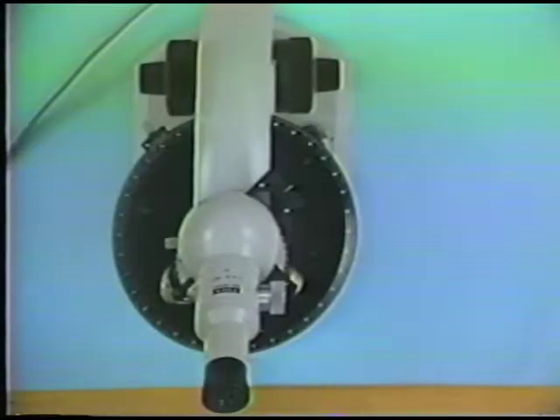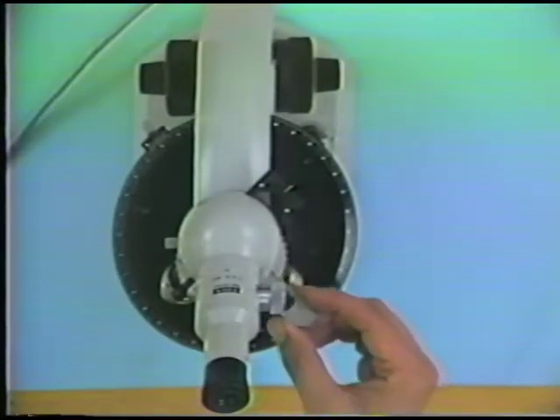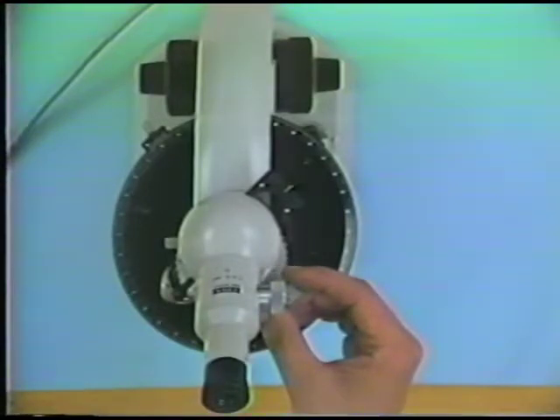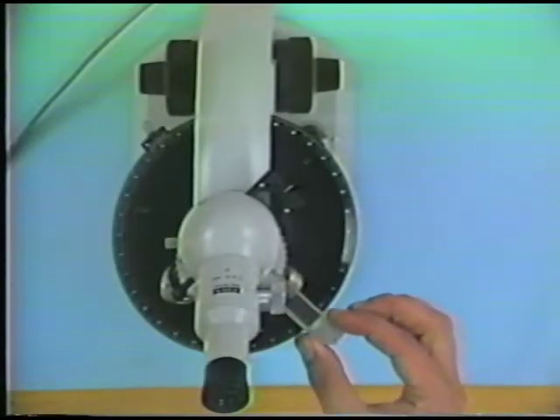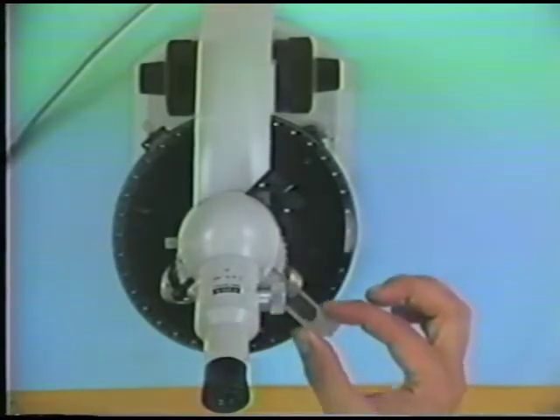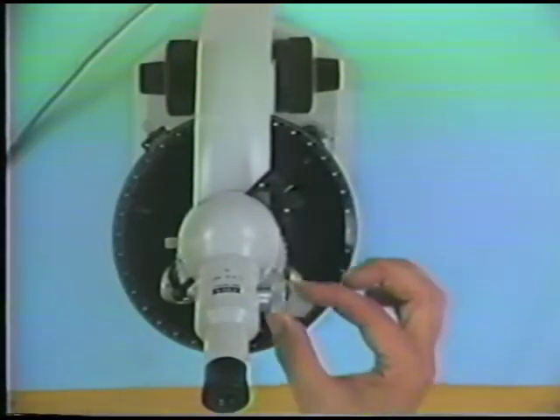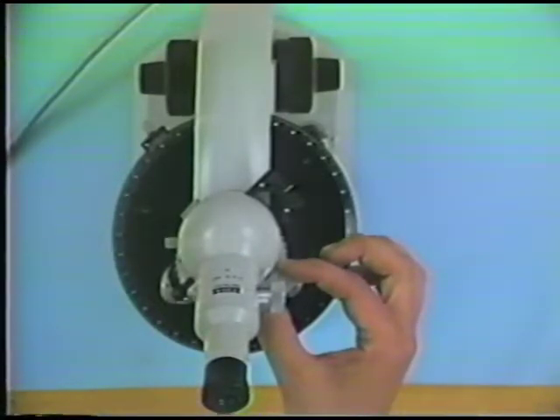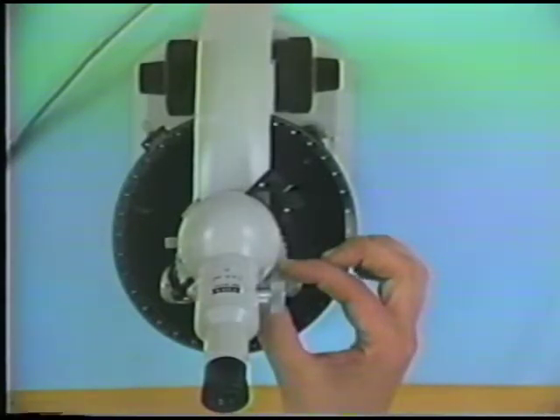Now I can measure the location of the slow ray by using the quartz wedge now in the accessory slot. And so I insert the quartz wedge into the accessory slot. Now, I'm going to switch to the microscopic view here in a second, but I want you to keep in mind the motion of the quartz wedge when I say I'm sliding the quartz wedge in. That's the time when you want to look at the pattern of interference colors. It's during the time that I'm sliding the quartz wedge in, and that means that the retardation that I'm imposing is increasing all during the time that I'm sliding the quartz wedge in.